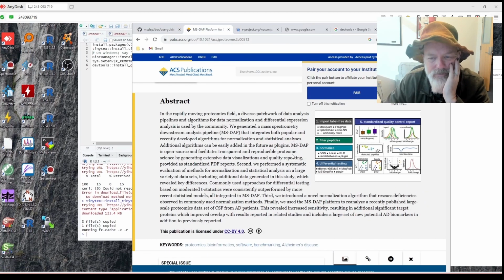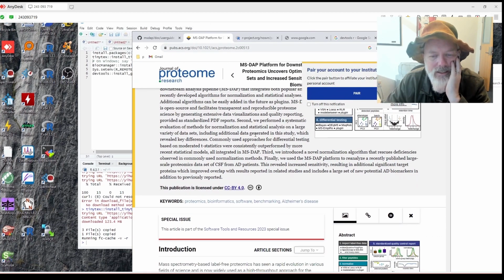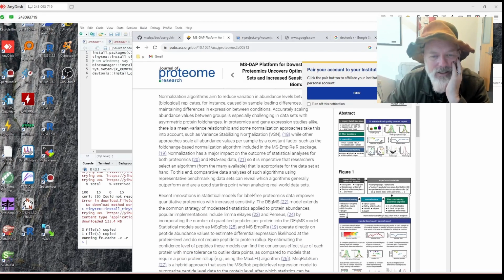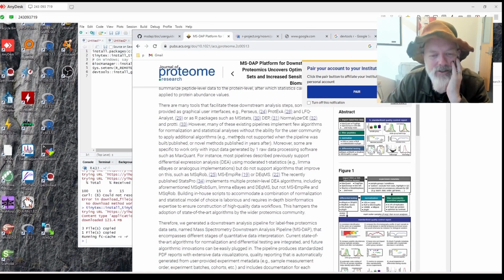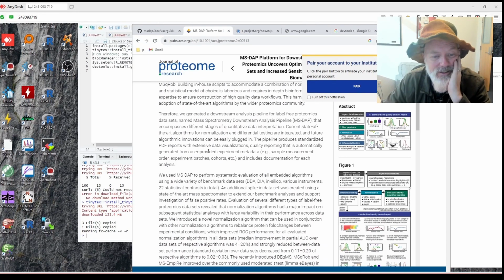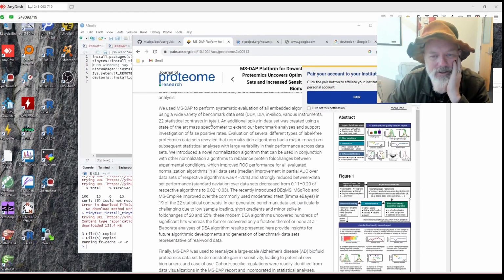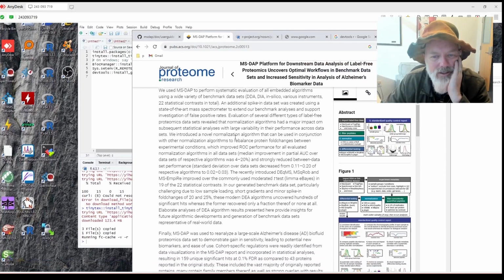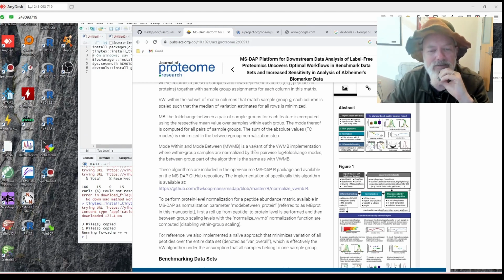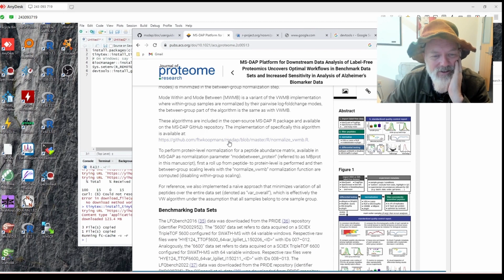Okay, so let's see what MS DAP does. So it takes the data on the peptide level, rolls it up, does MaxLFQ, which is very complicated. Basically, it's ratios across different samples with peptides. This is what everybody uses now. So Spectronaut, FragPipe, they all use MaxLFQ. I've mentioned this in several other videos: I've never seen a good explanation of how MaxLFQ works. If someone has a video of that, let me know.